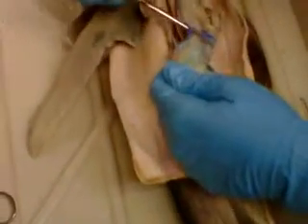And then on this side, it will branch to the duodenal, onto the duodenum of the small intestine. So, again, that was the pancreomesenteric, branching to the pylorus, duodenal, and intra-intestinal, underneath the pancreas.